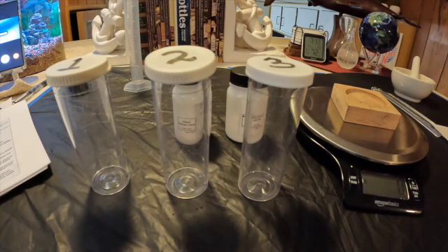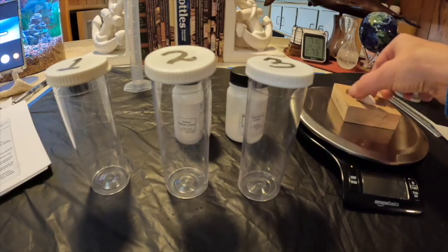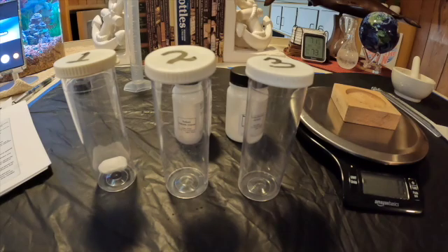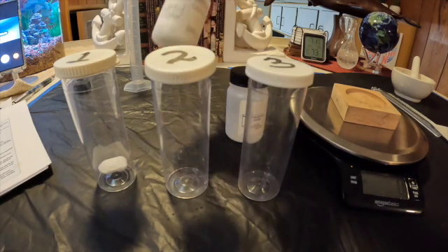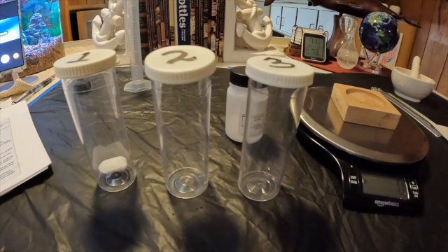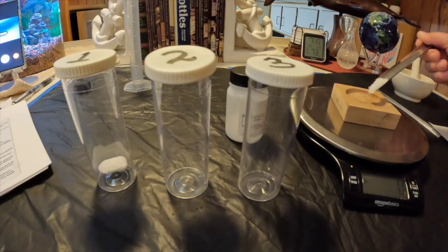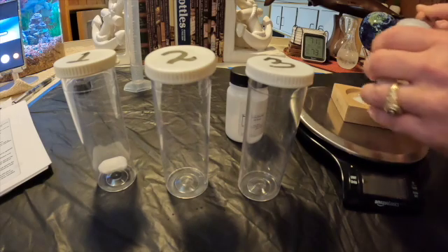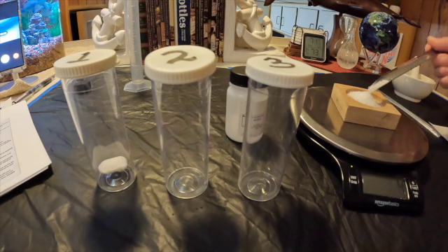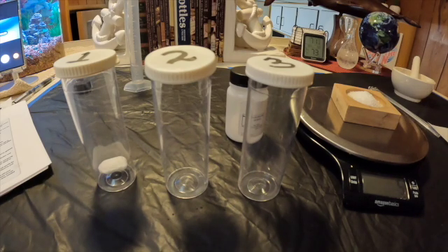In vial one, it's already five grams of pellet salt. For vial two, we're going to measure out five grams of coarse grain salt. So we measured out five grams of the coarse grain, which goes in vial two. Vial one was the pellet salt.